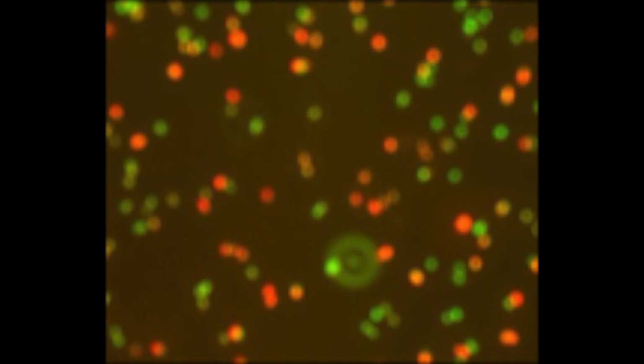Now you are ready to start visualizing your cells. So we suggest go ahead and take a trans image of your well just to ensure that you know where your cells are located. Then you can go ahead and take the overlay photo that we mentioned in the previous section, and this will give you the picture of live cells that are green and dead cells that are red. This is just another variation of what your overlay can look like, and this is when you can start counting those colored cells to get your viability count.